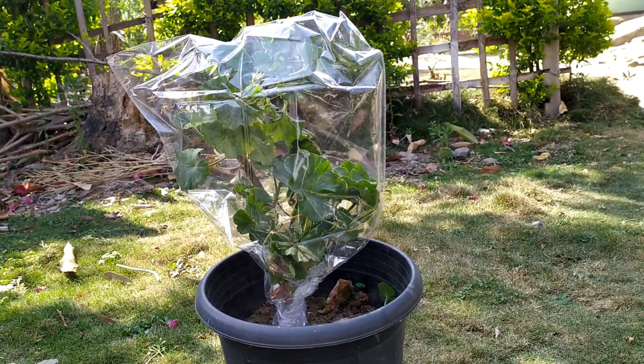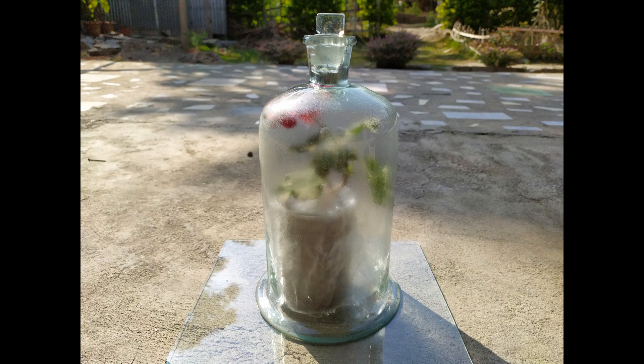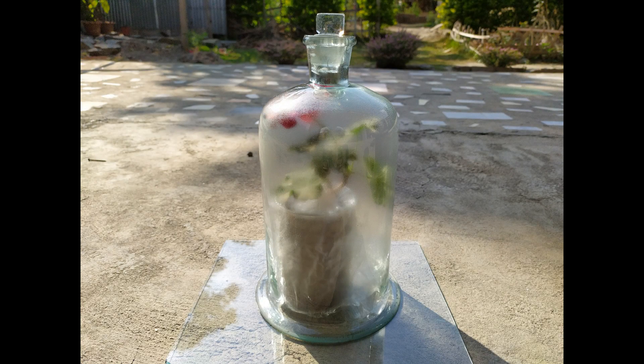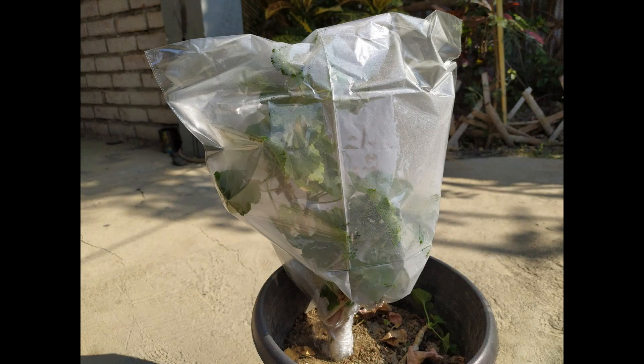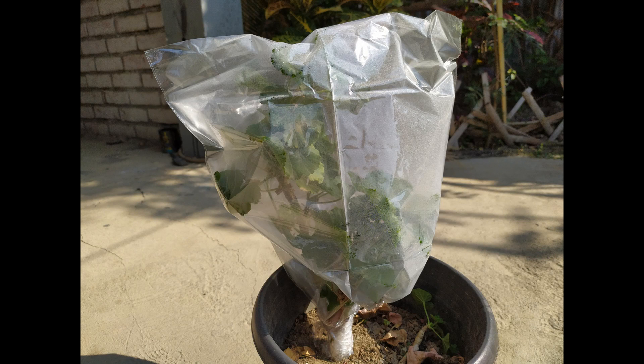After a couple of hours, observe the interior walls of the bell jar or the plastic bag. If transpiration has indeed taken place, you can see tiny droplets of water vapor on the interior walls of the bell jar or the bag. These droplets were formed as a result of the condensation of water vapor released from the aerial parts of the plant through the process of transpiration.